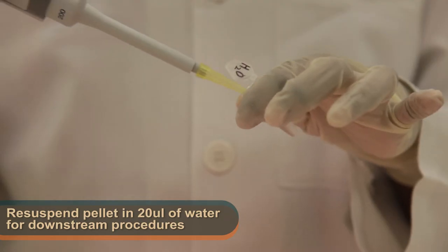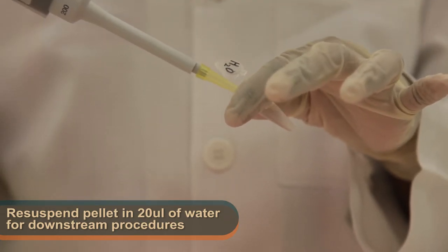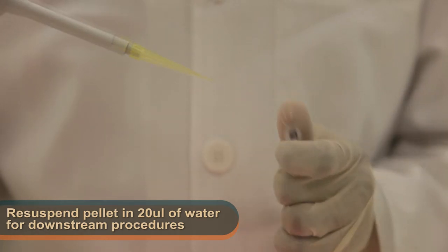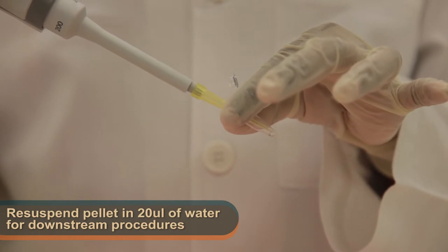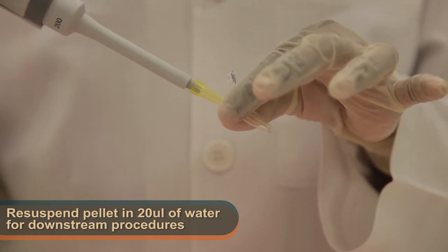Lastly, resuspend the pellet in 20 microliters of water to store for further downstream procedures. Please remember to label your tubes properly along with your initials to avoid confusion.